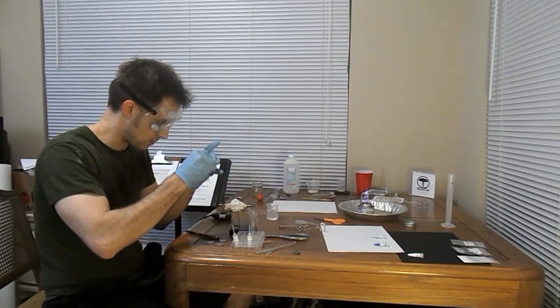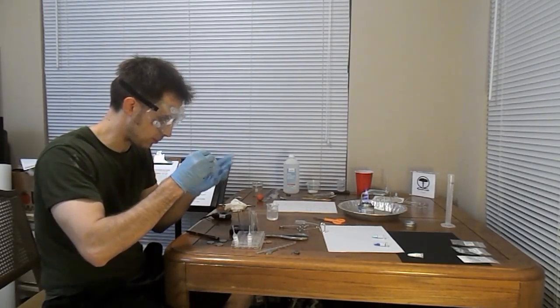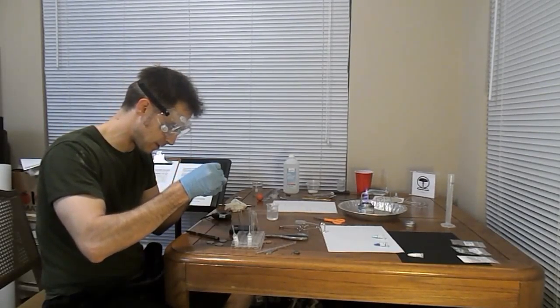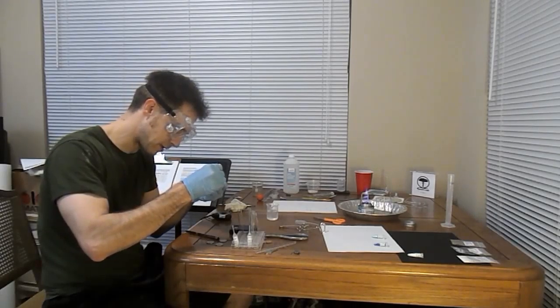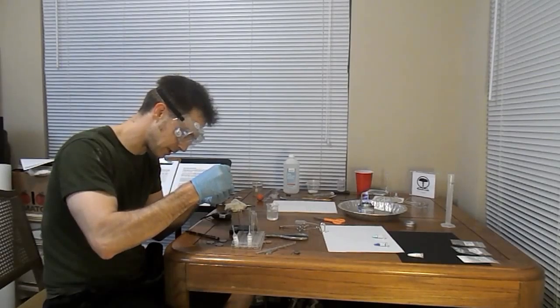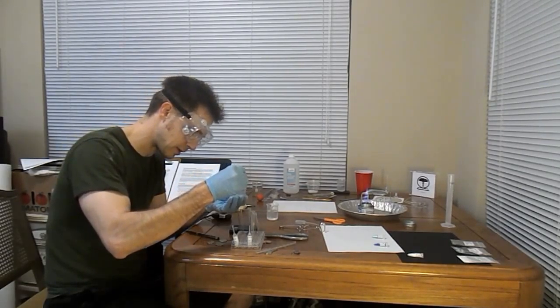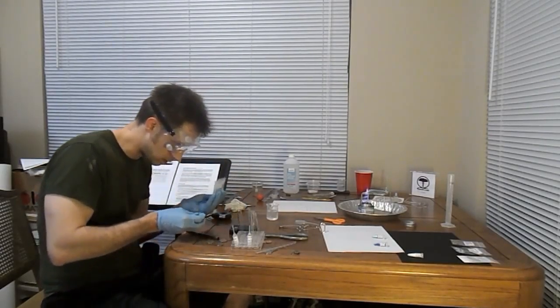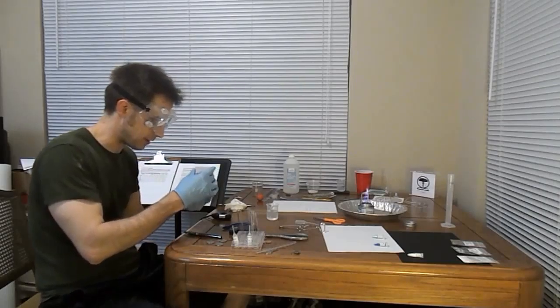Alright, so we got some magnesium here, physical properties. It's reflective, metallic, kind of irregular in structure. There's something about it that's a little bit milky. It's not quite shiny like you'd expect a chrome or steel surface to be. And we're going to decide that that's enough of that substance.